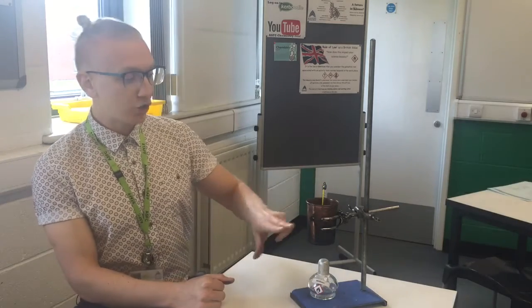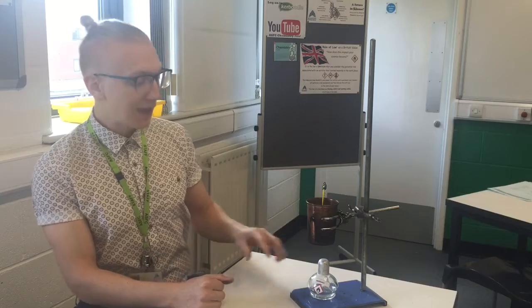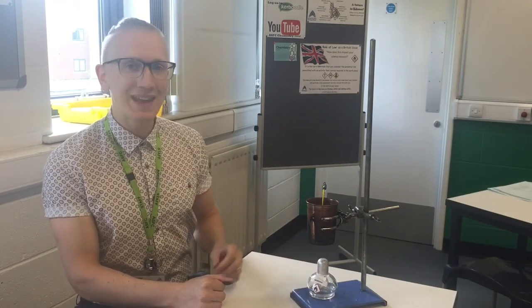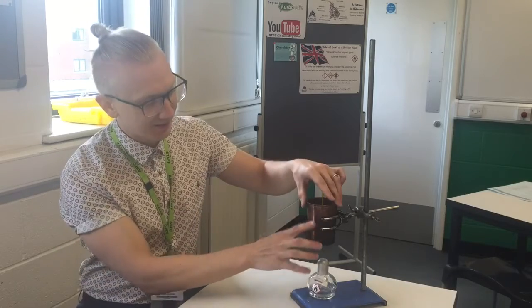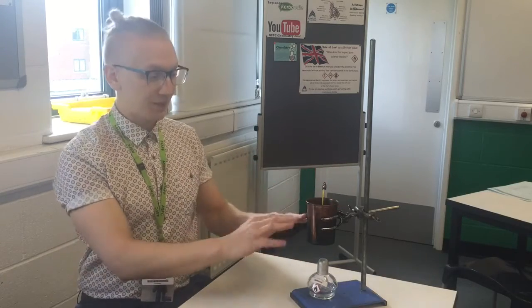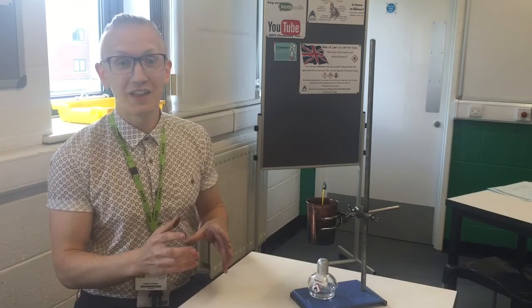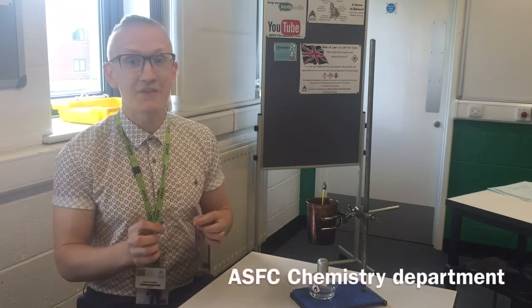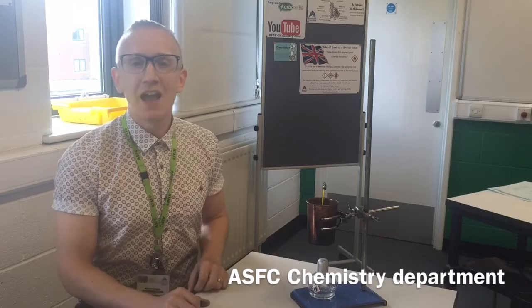Specific to the combustion calorimeter: it could get so hot that water evaporates out of the top, or we could get incomplete combustion. What I've unfortunately got all over my hands here are carbon deposits which have appeared on the sides of the calorimeter because of that incomplete combustion. So we're not getting the maximum energy from the fuel because some of it is released as carbon — which we can visibly see — or as carbon monoxide.